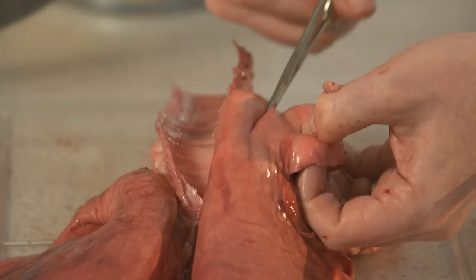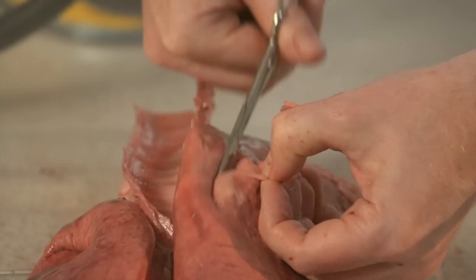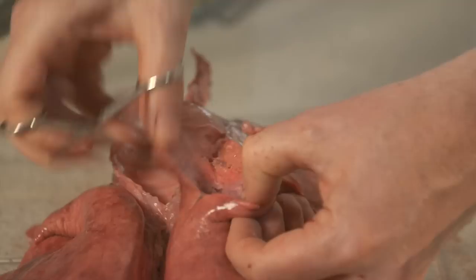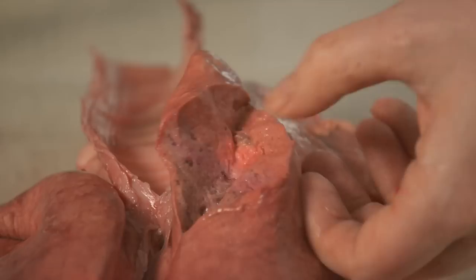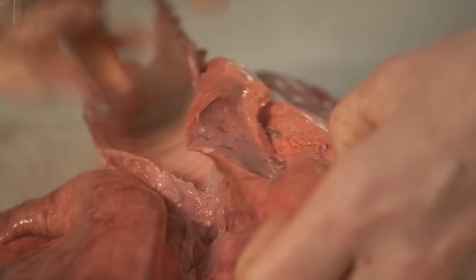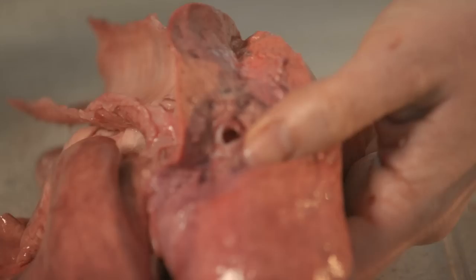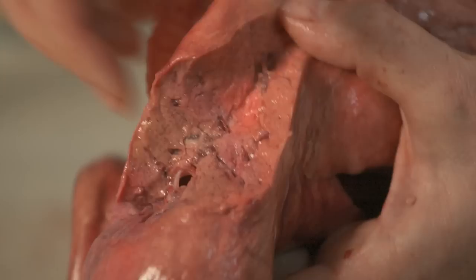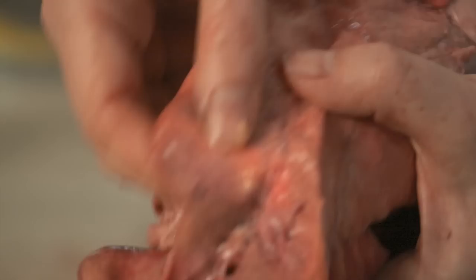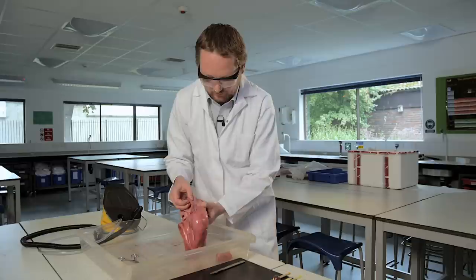I'm going to cut through one bit that I inflated earlier and see if there's any colour differences. There we go. As we cut through, we can see it is still very spongy. And there are loads of tubes. And we can see the spongy nature. It's actually easier for students to feel the spongy nature. They'd have to get very close up to see the spongy nature. It's very, very light.